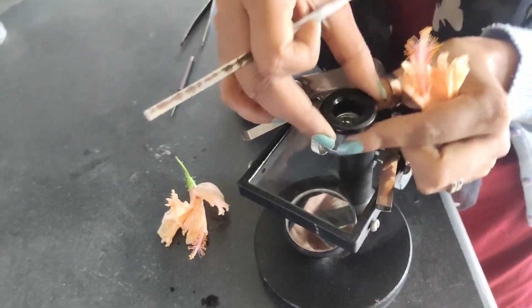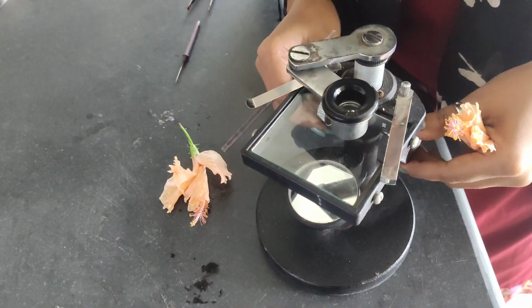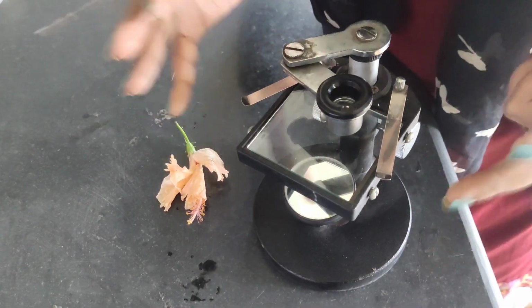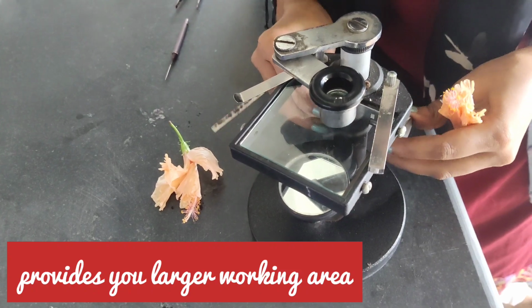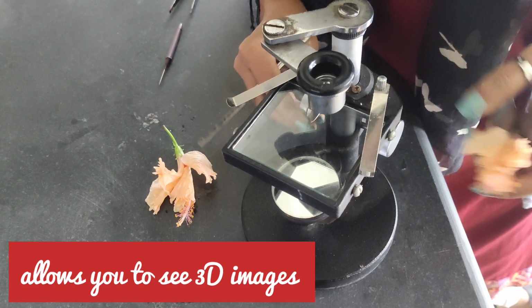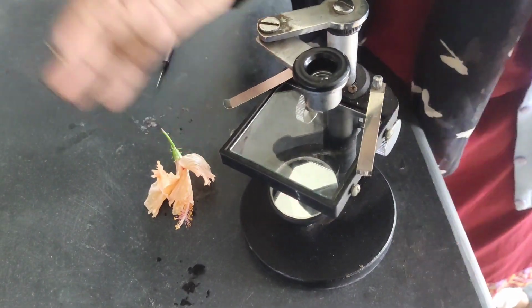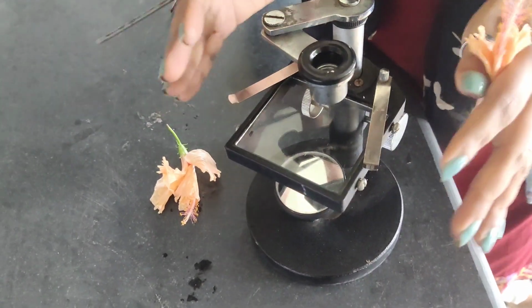It is just 10x because the best thing about this microscope is this is gonna provide you a larger working distance. How come? Here you can see the focus, right? This is the focus part. It's a focus knob present over here. Because of this you can see that this much is the area for my working area, which is not possible in the compound microscope. That's the best part about this.